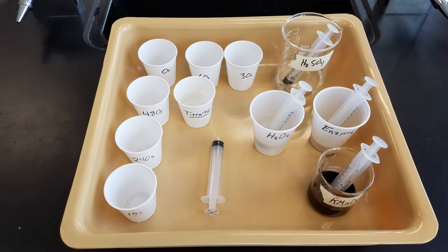When you arrive at your lab counter you'll see your tray with all your stuff in it just like this. Please make sure it returns to this state when you are all done with your lab today.